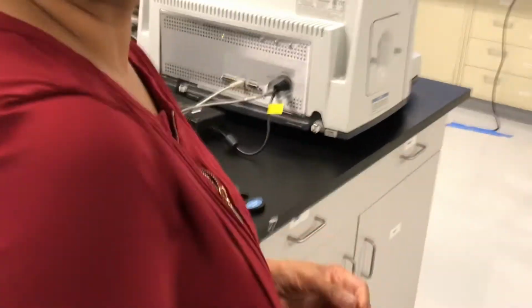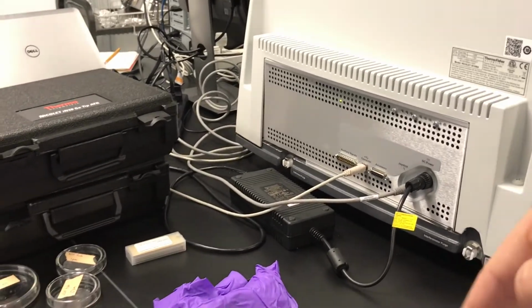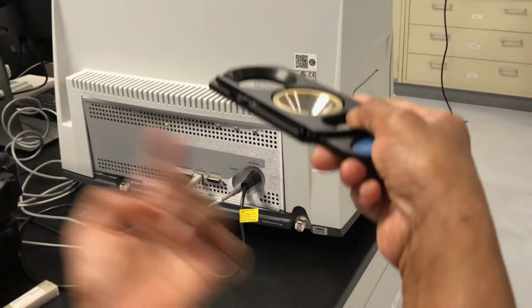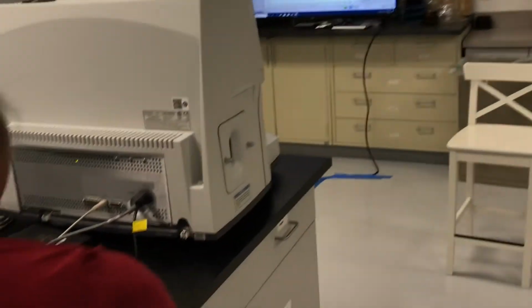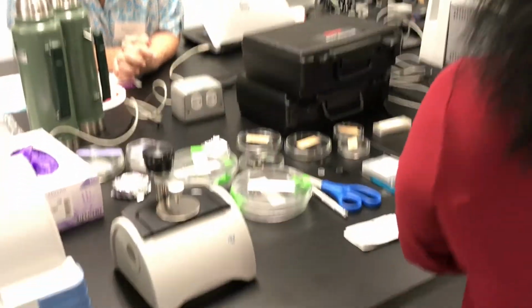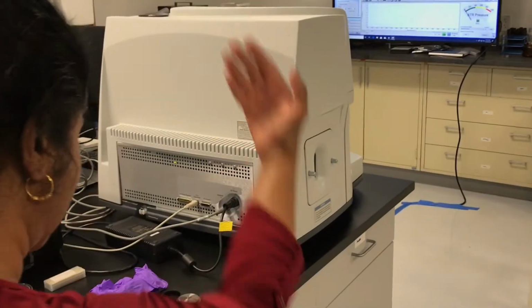And so the physics of this is that it's going to collect the beam, and then it's going to be focused through. If we insert it like that, it goes right in. The beam comes, and this is the tip that makes the contact, touches the item. Opposite of the other one. Here the ATR sits like this, came down, because here it is still reflectance mode, so the beam has to come down and go back up.